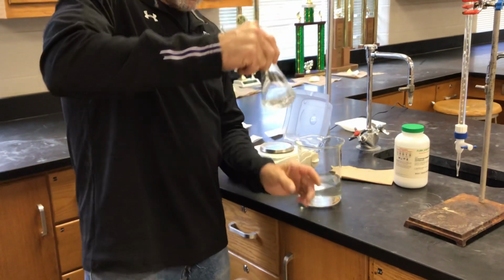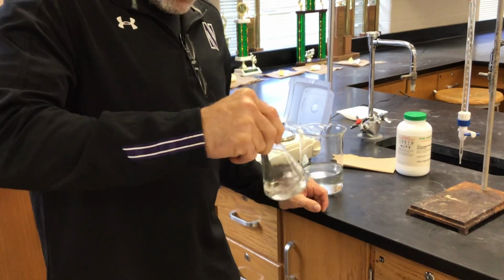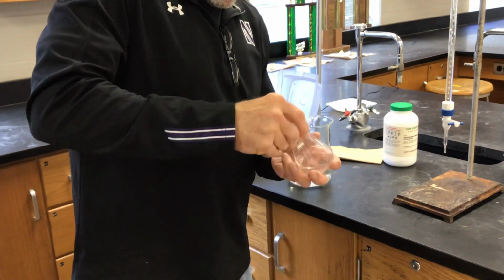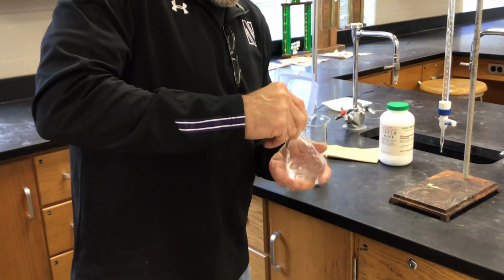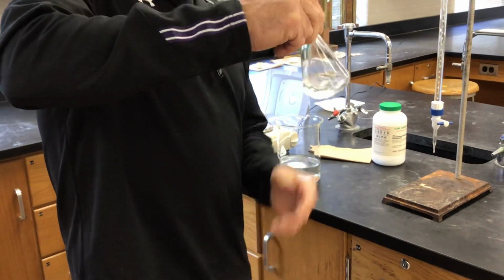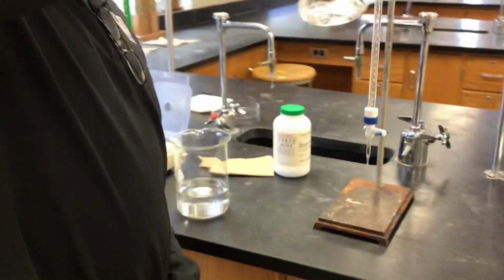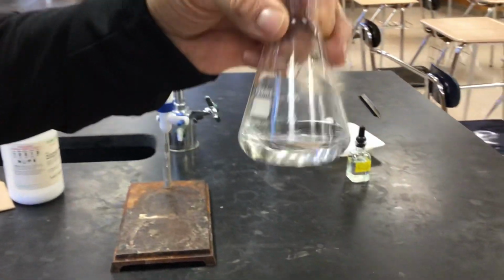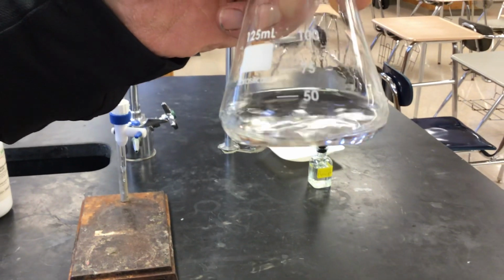So you do have to be a little patient. It does take a minute to dissolve. And of course, I can't see anything without my glasses on. So right now I don't know if it's dissolved or not. Mr. Moore has better than perfect vision. I think I still see some. There is still some in there, yep.